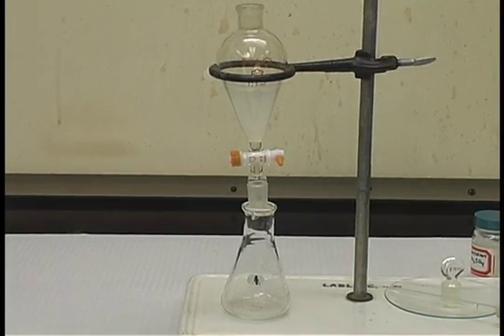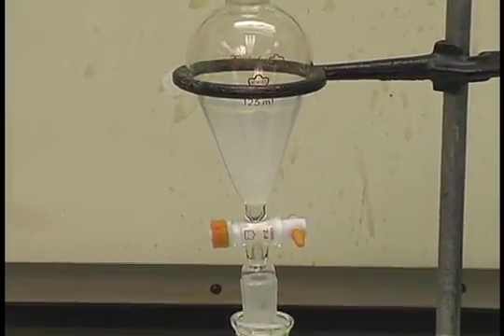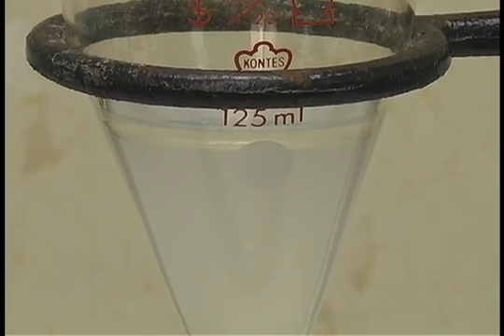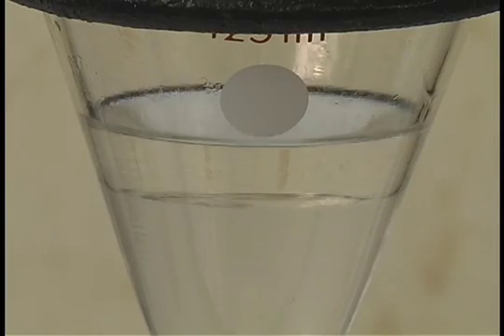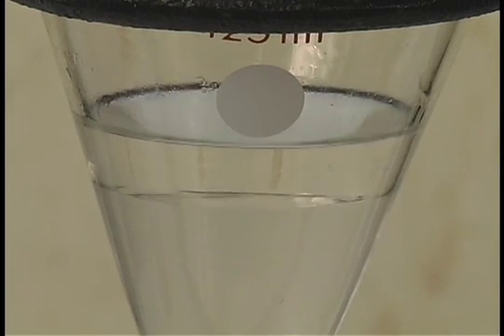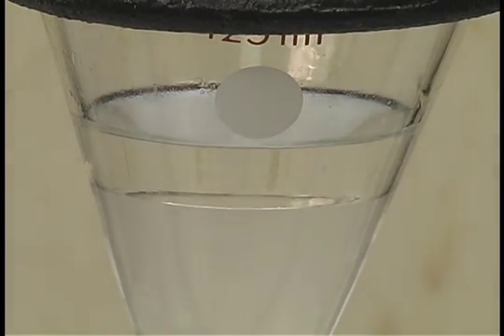If the bottom solution is water, the drop will travel through the upper liquid, and then you will see it strike the bottom. If the upper liquid is the water, then the drop will not travel through. Just a couple of drops, and you should be able to see it actually travel through and then strike the bottom solution. So the bottom solution in this particular case is the aqueous solution.